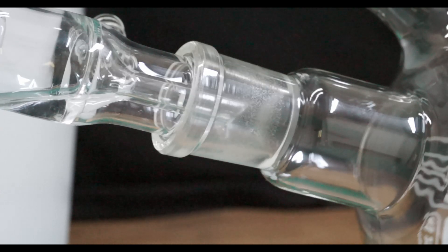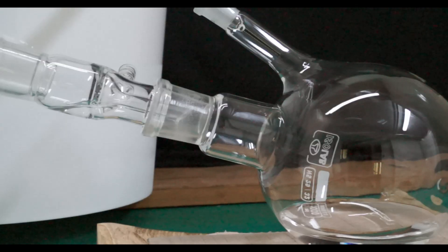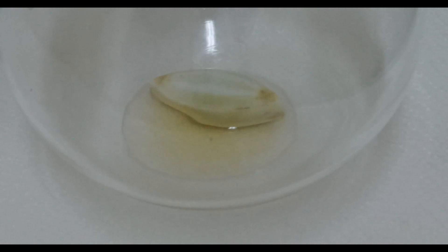I emptied the collecting flask and then I collect everything boiling in the range of 34 to 39 degrees Celsius. The majority of the product comes over from 34 to 36 degrees Celsius. There is very little residue left in the boiling flask.